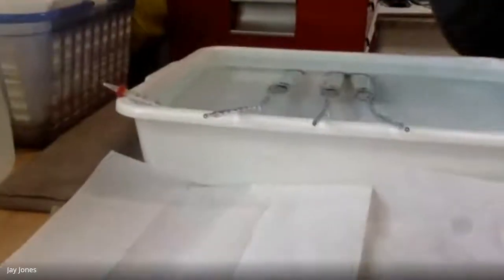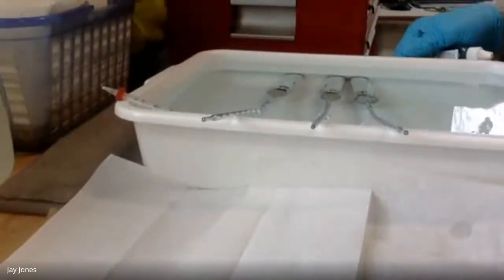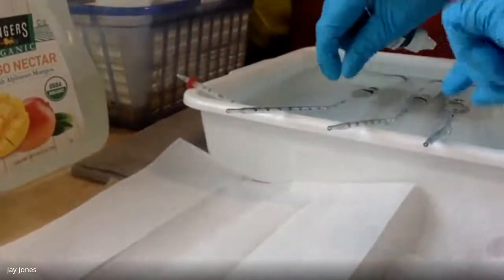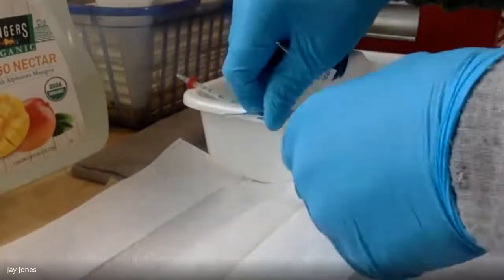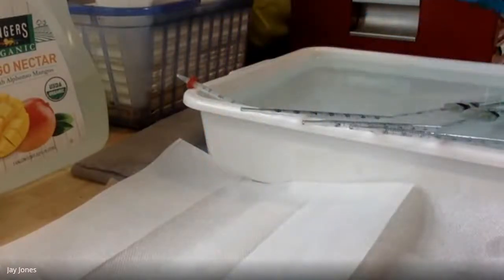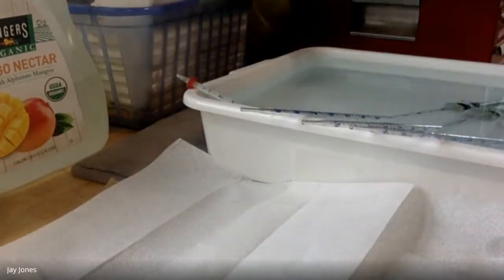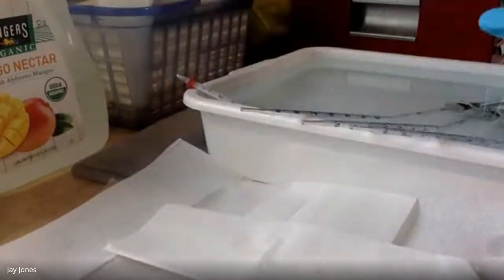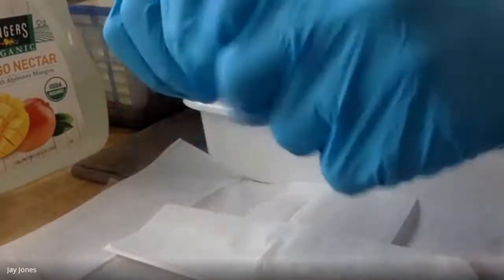Okay, I think they're ready. I think I've rambled enough about that. Let's get to the fun part and color load these things. I'm going to turn it so you guys can see. This is the fun part. I really hope this works. It worked this morning. It took me a few minutes, and it got a little messy. I don't normally get this messy, but let's try. Here we go. So this is food coloring.